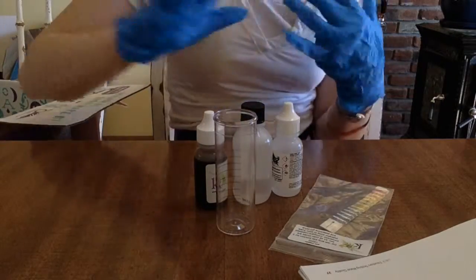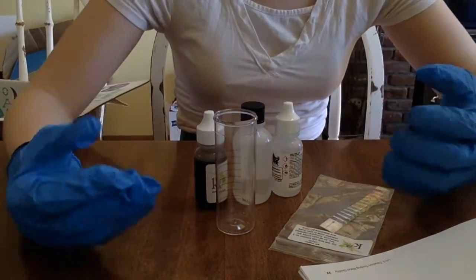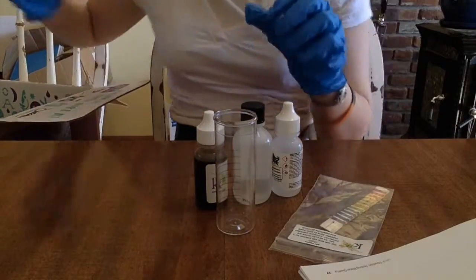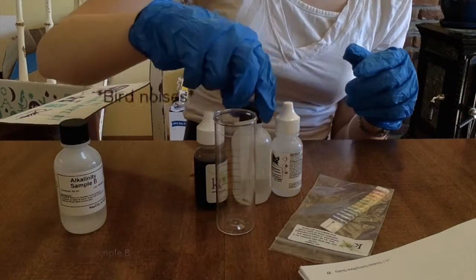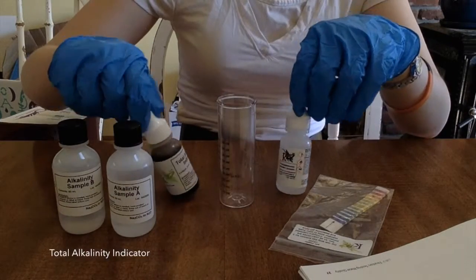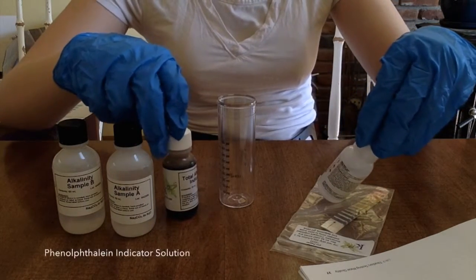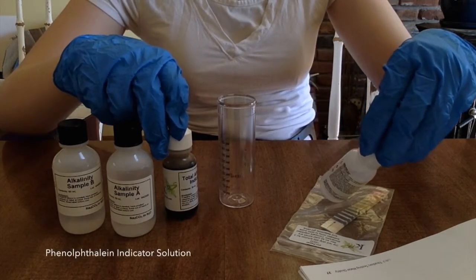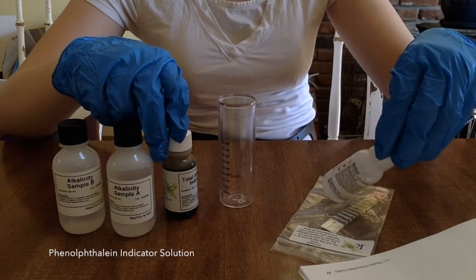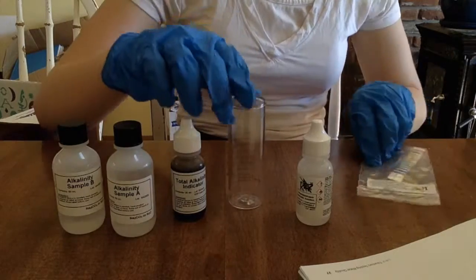Alright, today we have an experiment that has to do with figuring out pH levels of two different samples. So we got alkalinity sample B, alkalinity sample A, total alkalinity indicator, and phenolphthalein indica— phanil... We're trying to call it P indicator solution. And this thing has some pH paper.